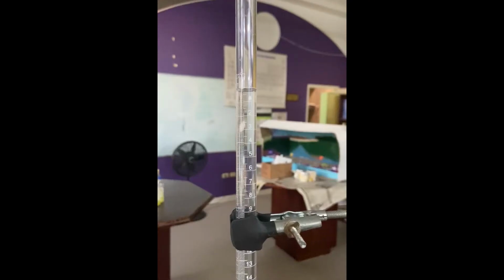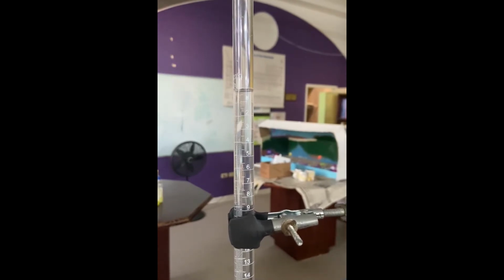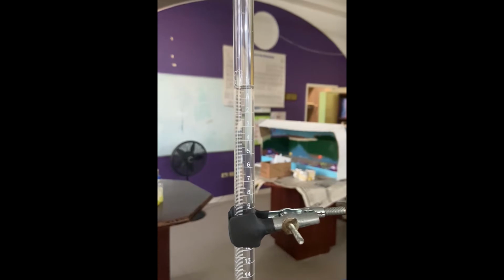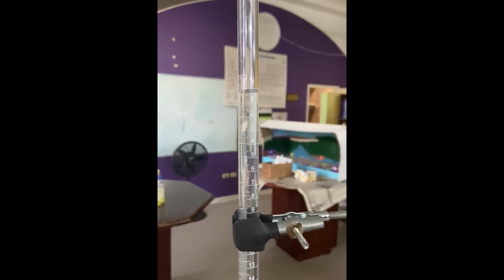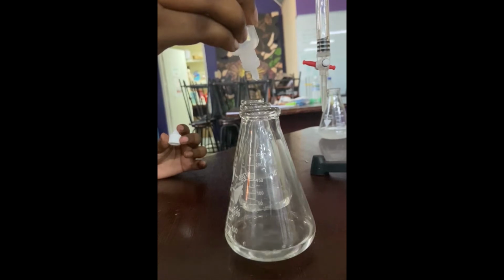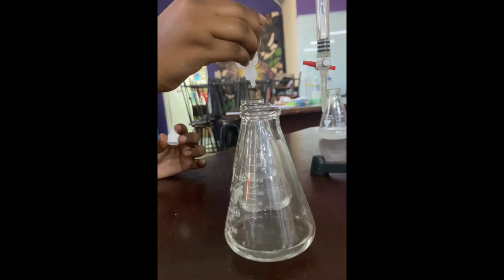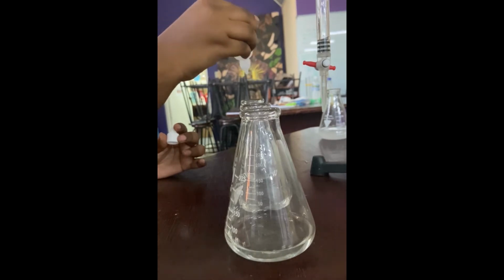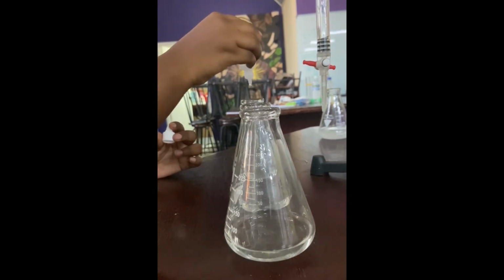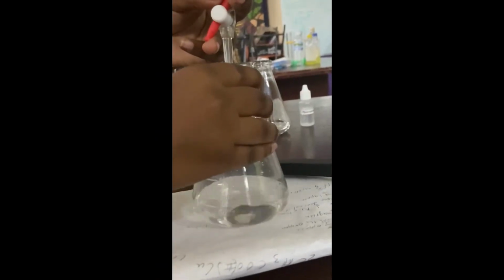To do this, we place our standard sample of sodium hydroxide into the burette and pipette 25 milliliters of the unknown HCl into 3 250 milliliter conical flasks. We then add a few drops of phenolphthalein indicator, which is colorless in acidic solutions but pink in basic solutions. The titration was then done until a light pink endpoint was achieved.